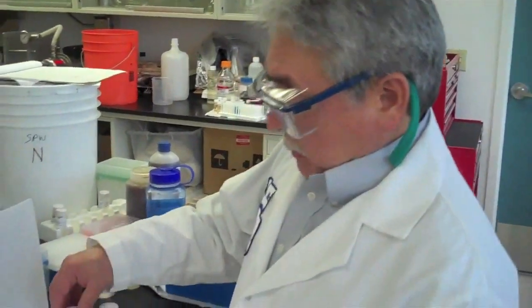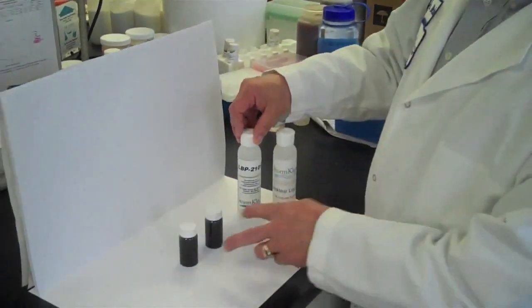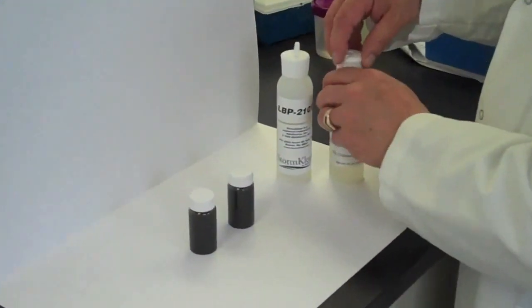Okay, next what we're going to do is demonstrate the use of the dual polymer system in removing or breaking an oil emulsion that we've obtained from bilge water.